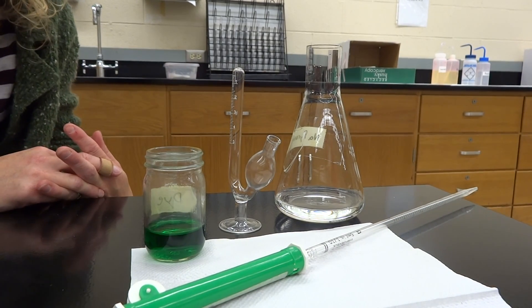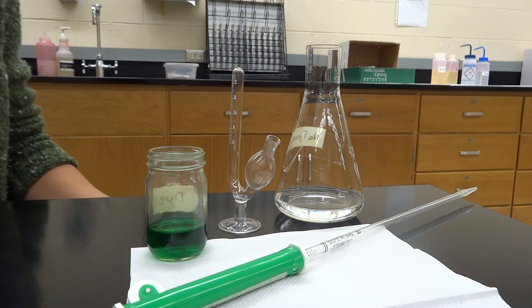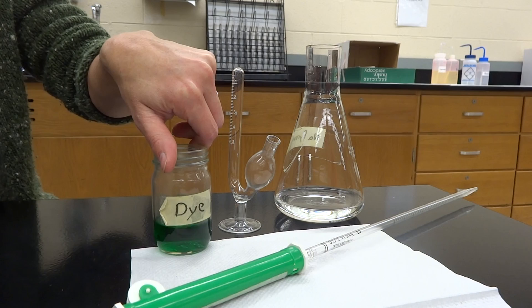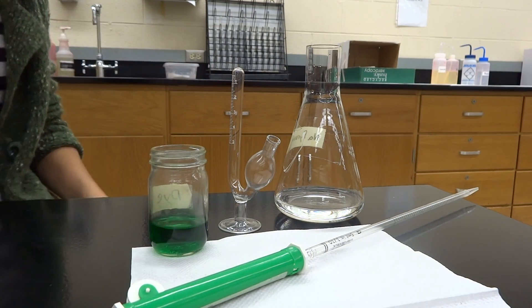So today we're playing with green yeast — green dye. It's not really yeast, and yeast isn't really green, but we want to show you how your alcohol fermentation is going to work.